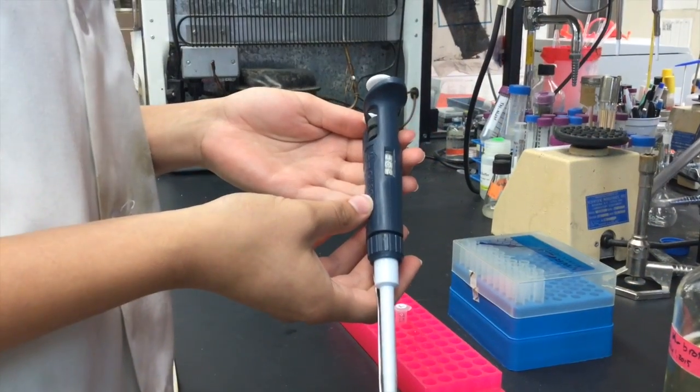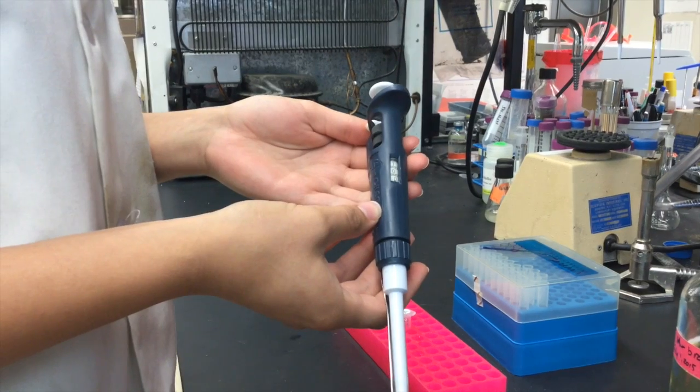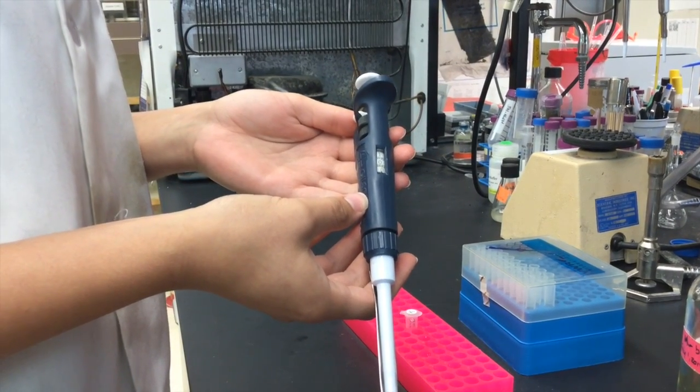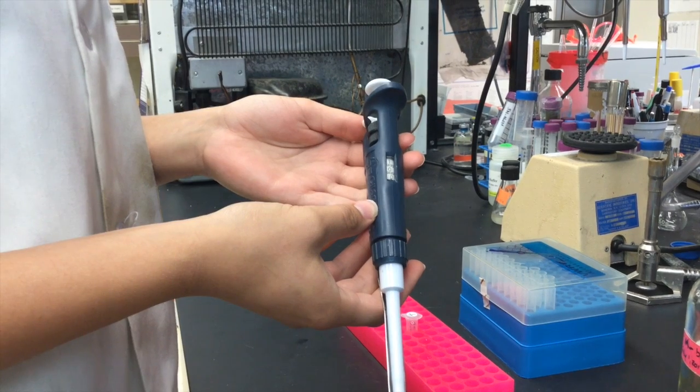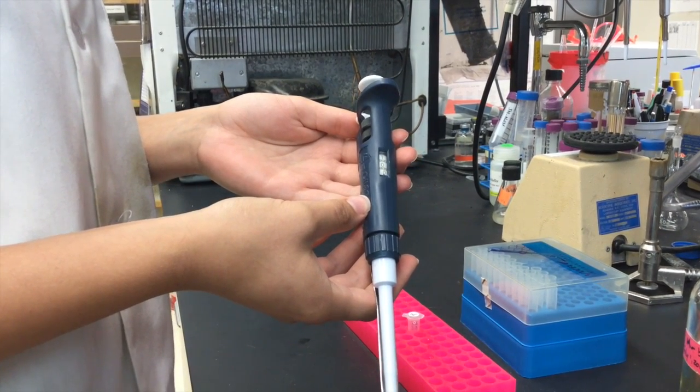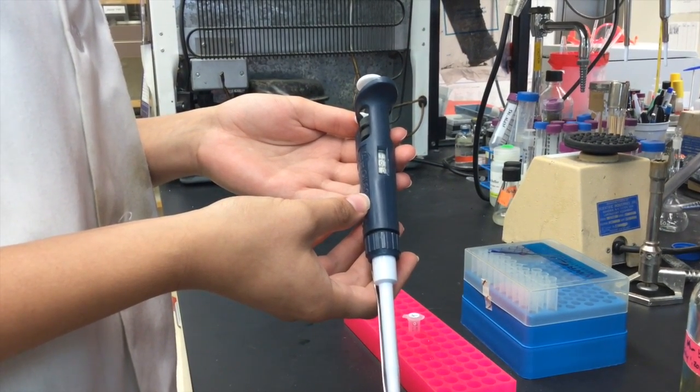When working with these instruments, remember to never exceed the upper or lower limits of these pipetters. This will damage the pipetters and each one costs $200 to $300. Just as a reminder, here are the limits again.